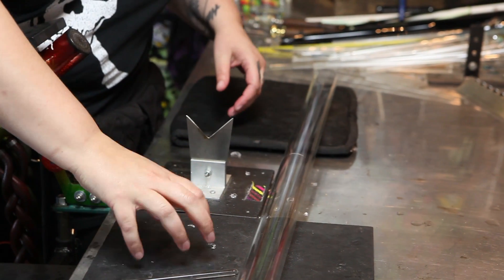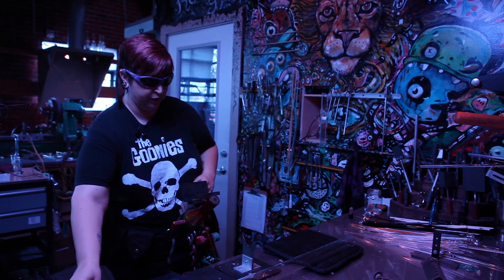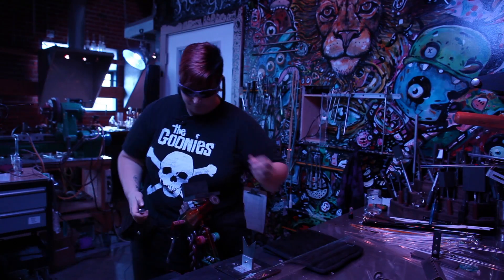I can get my hand underneath there so it's sitting on my graphite and on the pad here. You can use anything underneath it — it doesn't really matter as long as your score mark is up off the table.